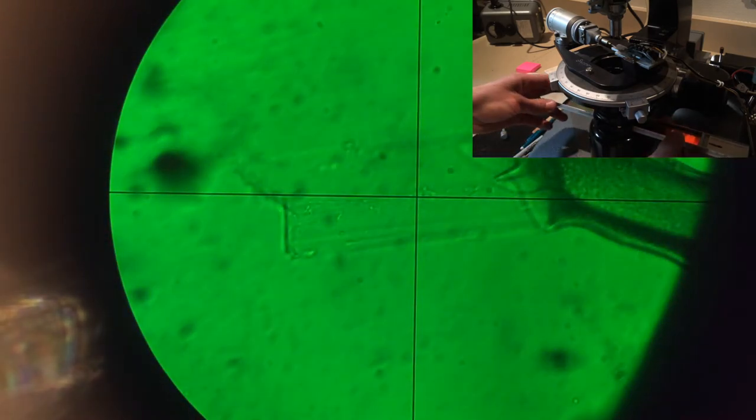I'm inserting a slide monochromator here, so it's going to look colored and kind of funky. As I slide it across, you can see that that fringe sort of disappears as I approach red light. But it's a bit out of the visible light spectrum, the match in the refractive index.